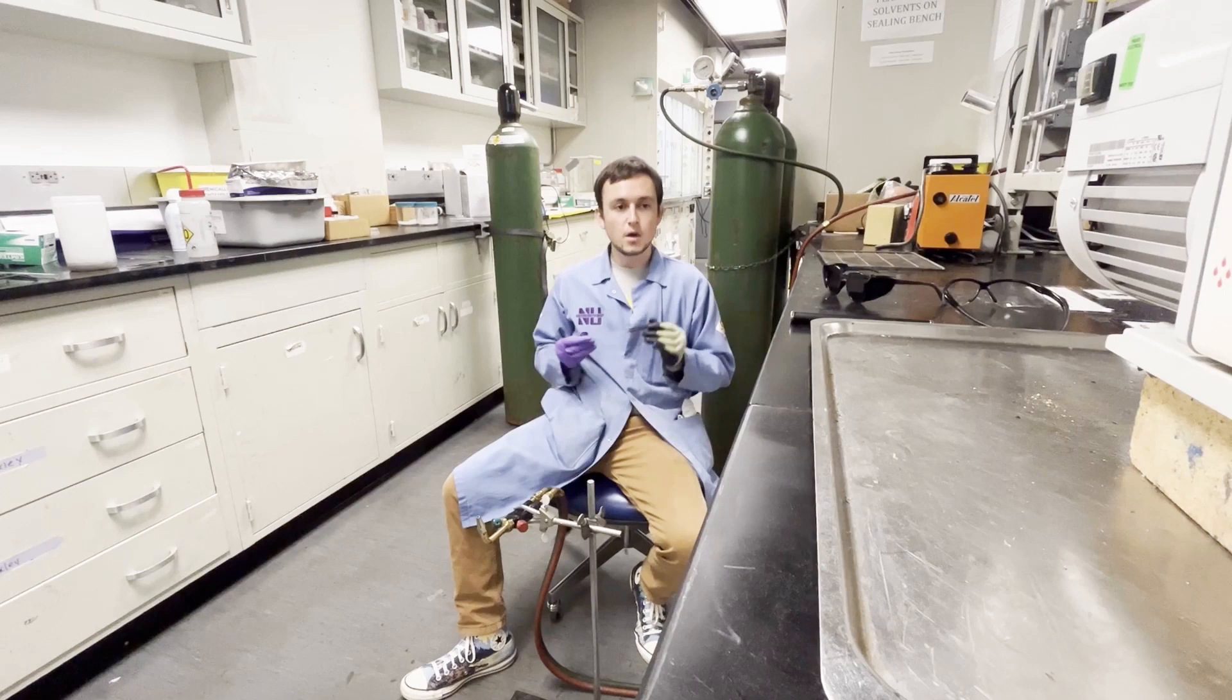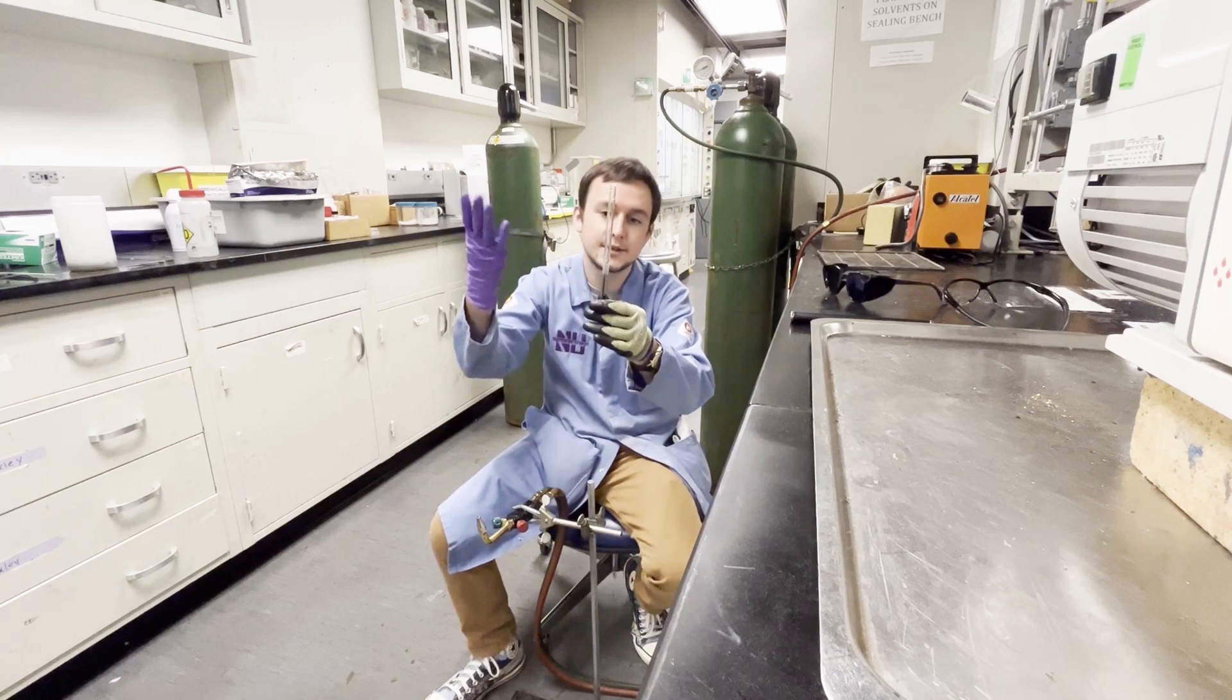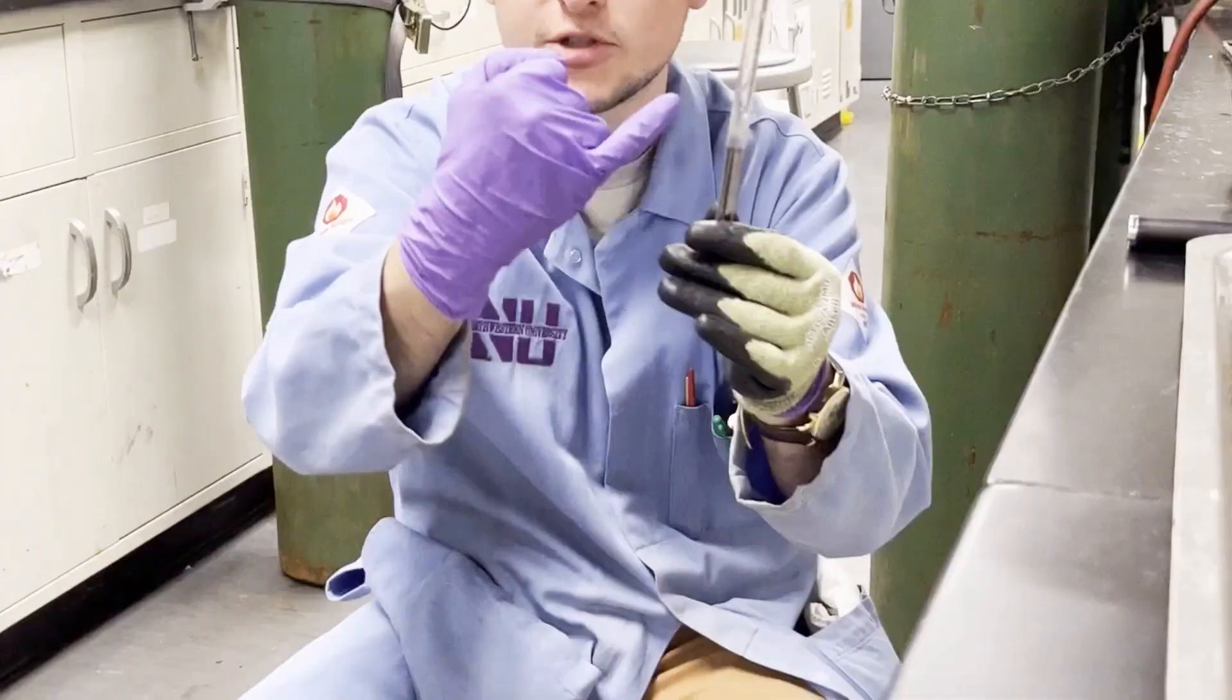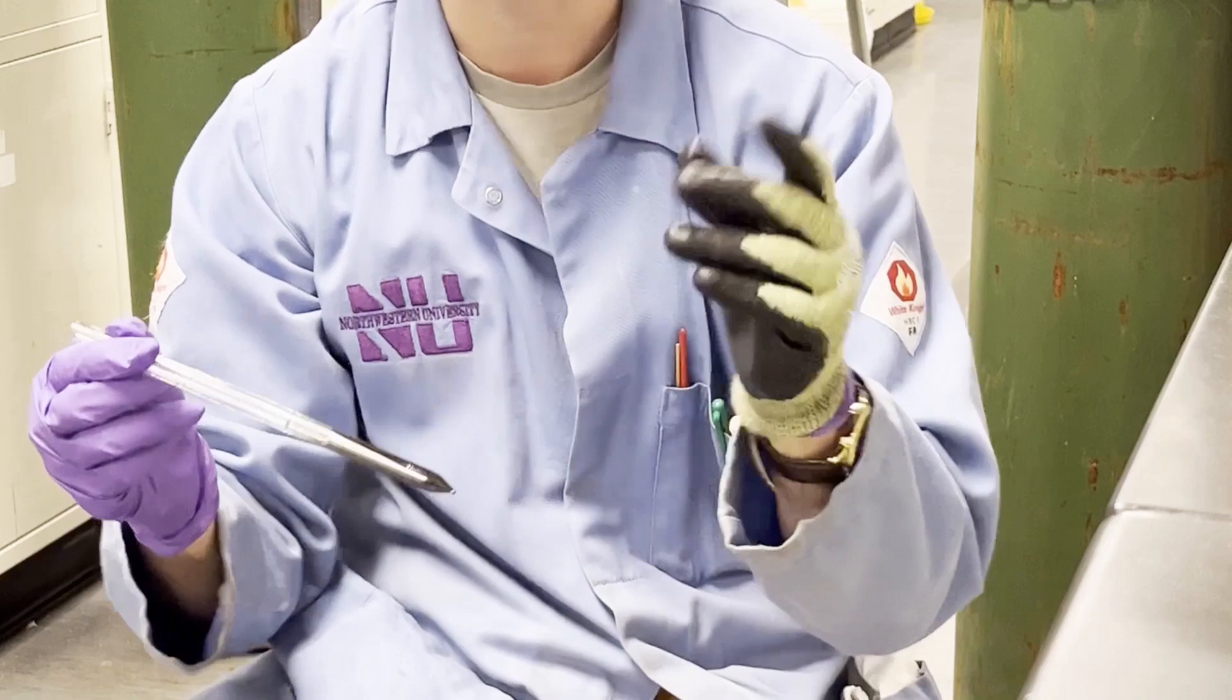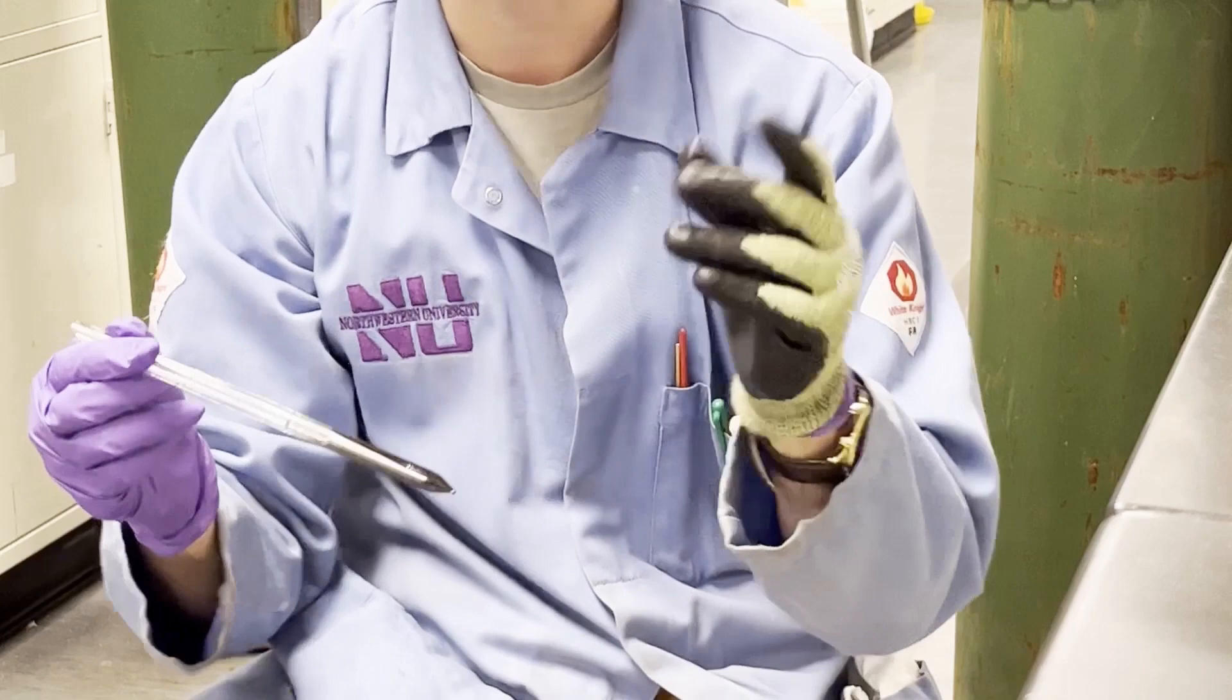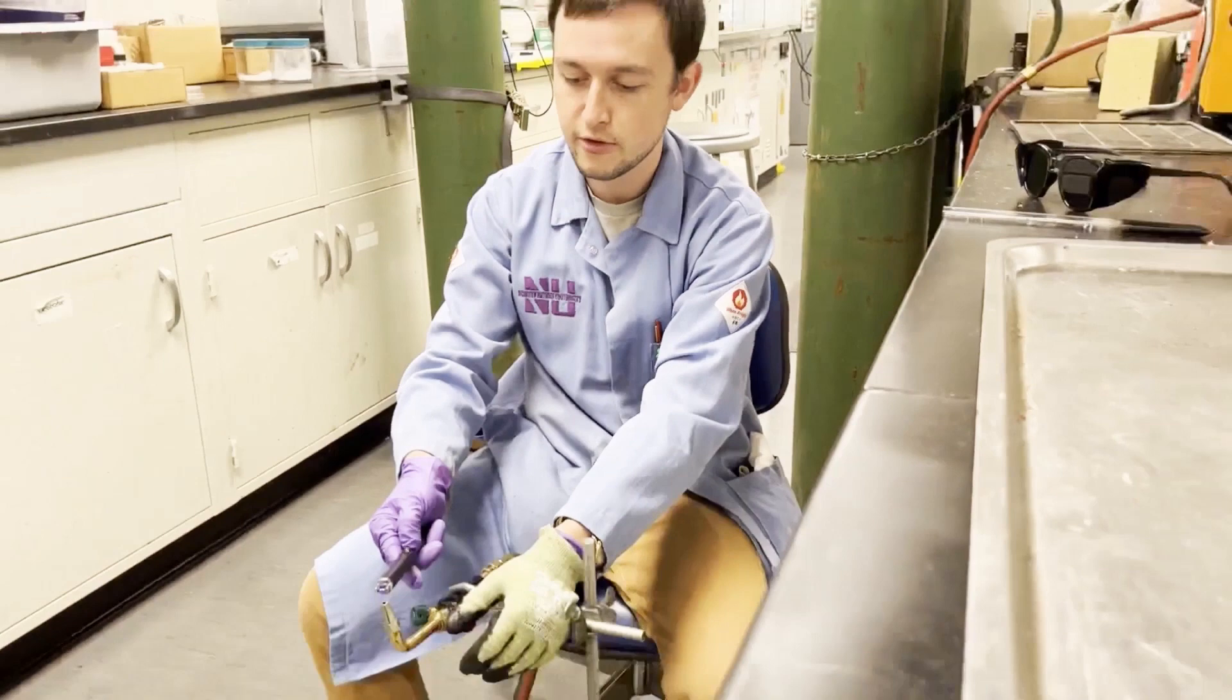Imagine you're a perfectionist—your carbon coat is really cosmetic at this point, but say you don't like all this schmoo at the end of your tube and you want to clean it and have it be nice and clean. What we've done here is we've taken our carbon coated tubes, we've rinsed out with DI water all of the extra little graphite pieces and acetone and goop that was still in the tube. So now this is wet with water. To clean this up a little bit, all we need is a methane flame.